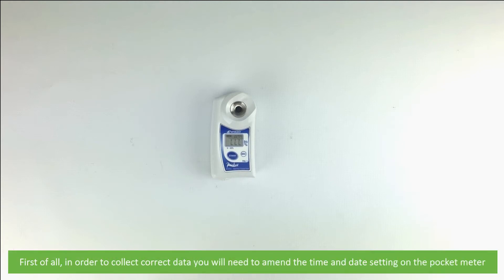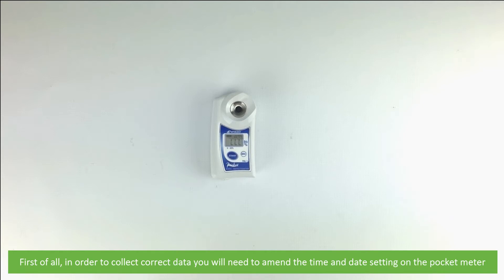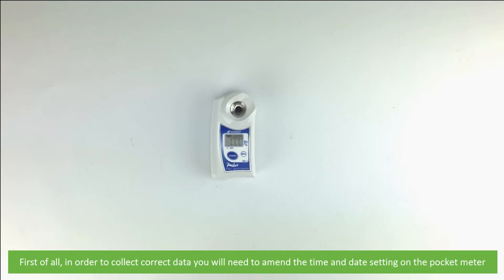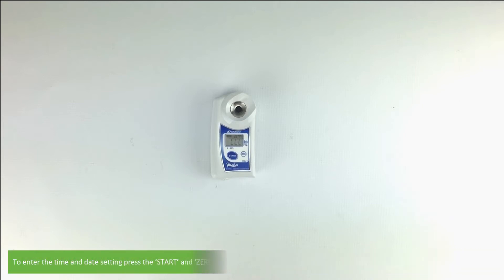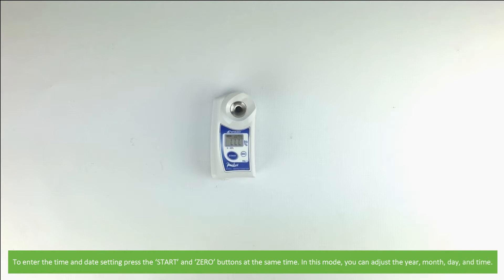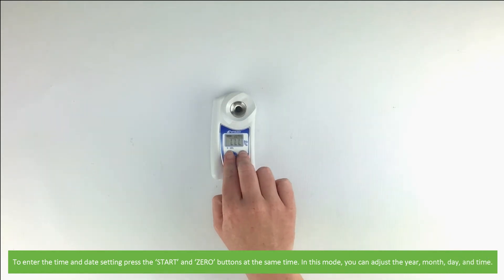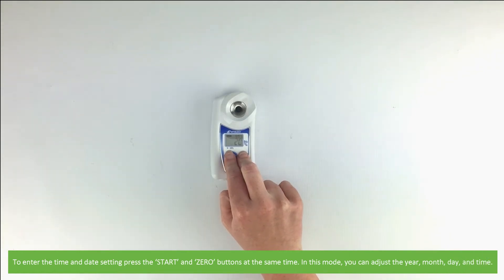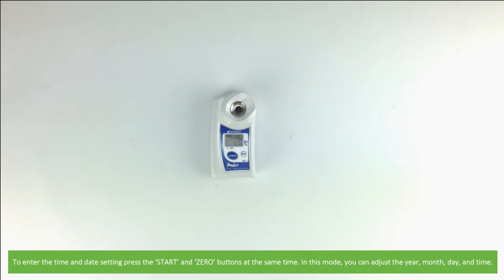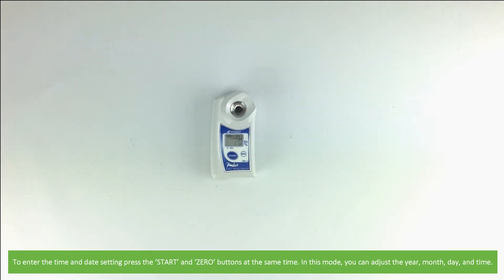First of all, in order to collect the correct data you will need to amend the time and date setting on the pocket meter. To enter the time and date setting mode, press the start and zero buttons at the same time. In this mode you can adjust the year, month, day and the time.